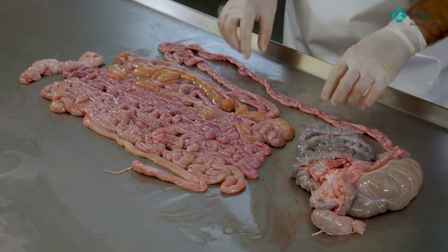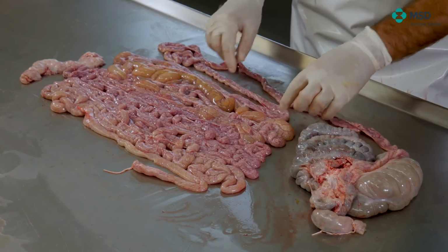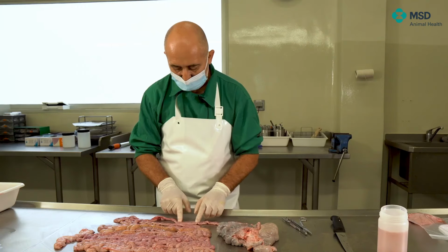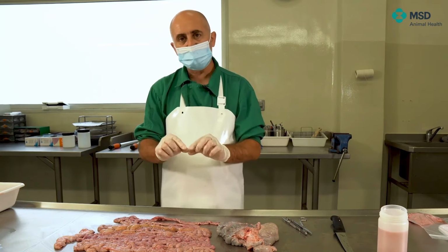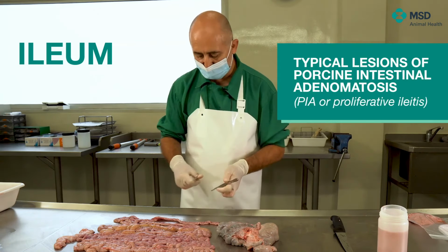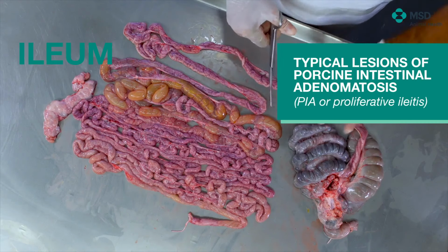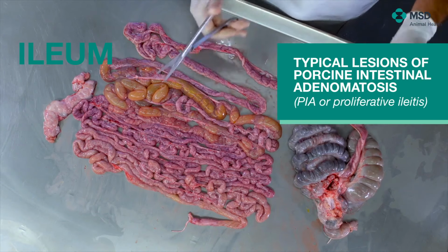Of course, when we have large intestine lesions compatible with swine dysentery, porcine intestinal spirochetosis, etc., PCR is the most typical technique to be used to detect those pathogens, but in a number of cases, especially swine dysentery, it's quite interesting to do isolation. As you have seen, I have separated the different loops of the small intestine, but not the ones of the large intestine, so we keep them together.